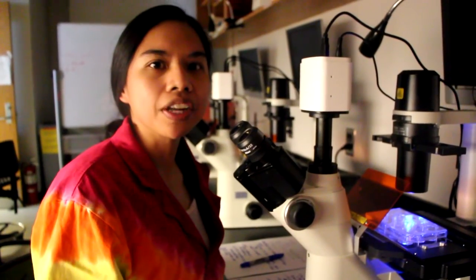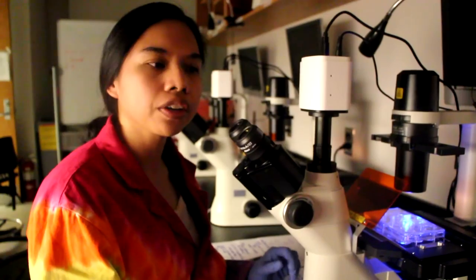In order to visualize red fluorescence, use the green LED in the back, or the G setting.